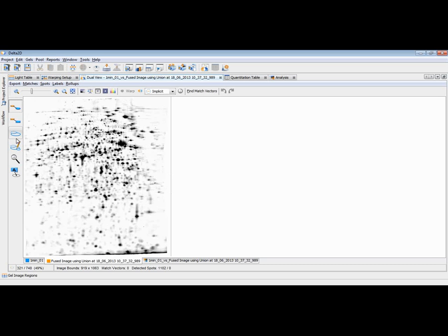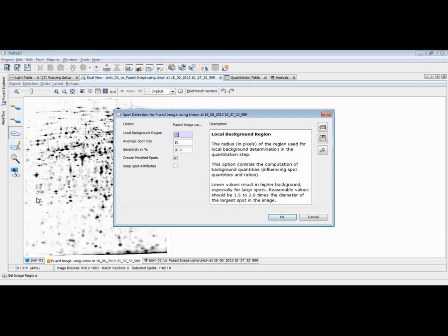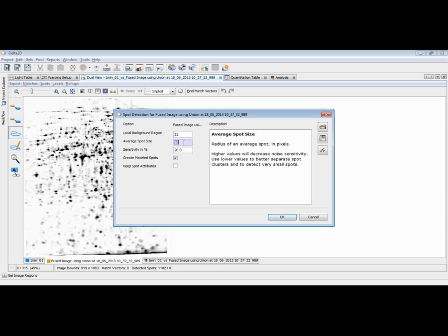So let's now detect spots on this image. I click the detect spots command in the workflow on the fused image. The spot detection parameters are described in this part of the dialog. If you click into the parameter field, the description is shown here and you can read it and change all these parameters.